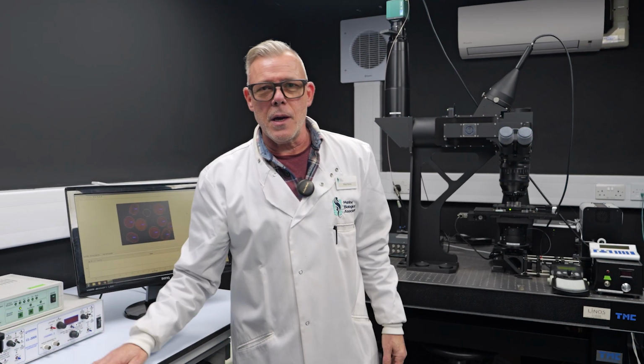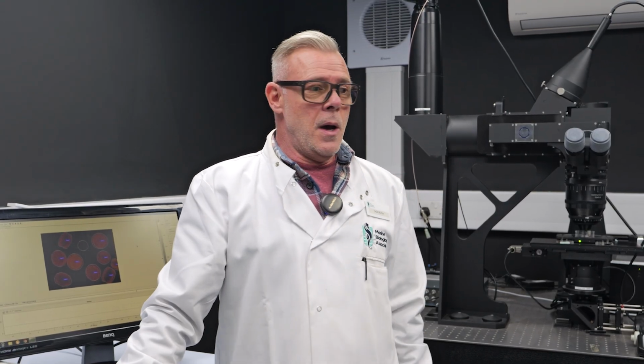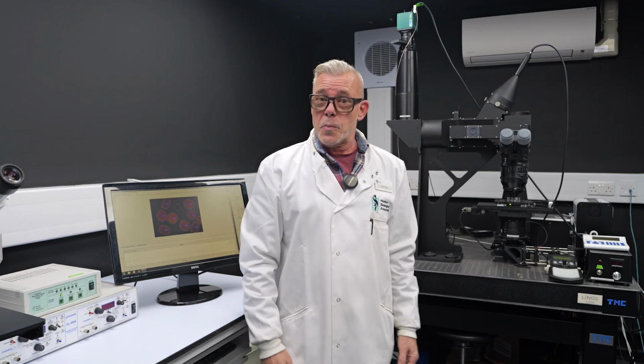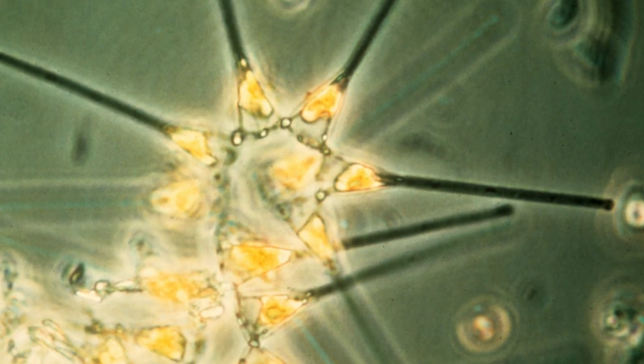Hi, my name is Matthew Keys, and I'm a postdoctoral researcher at the Marine Biological Association. I work in the Wheeler Group, and our focus at the Wheeler Group is the study of the physiology and biology of phytoplankton in the oceans.